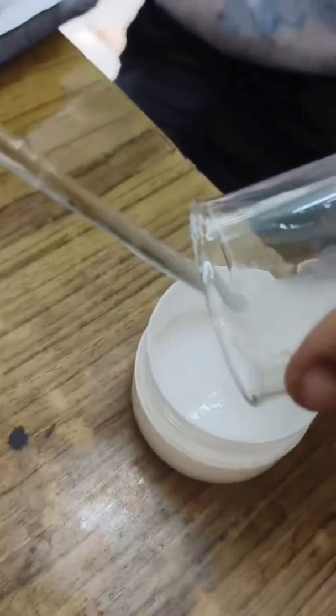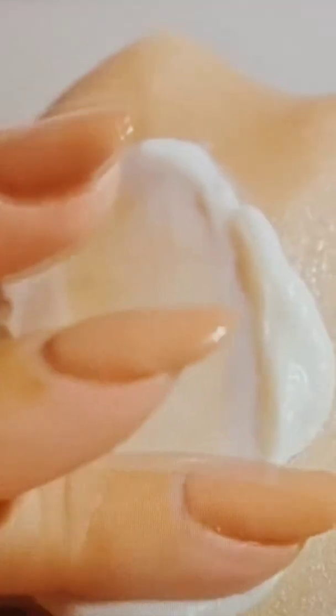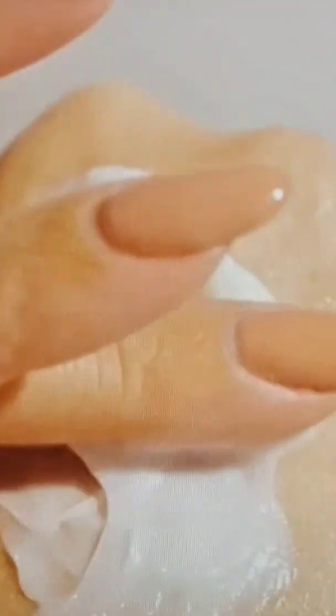The emulsion is stirred until it cools to room temperature and then packed in a clean container. This process ensures a stable and effective topical antiseptic cream.